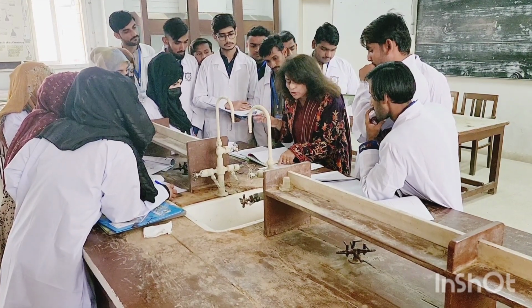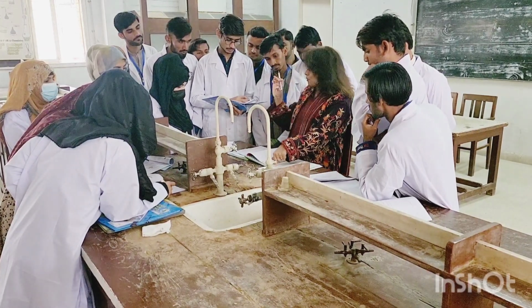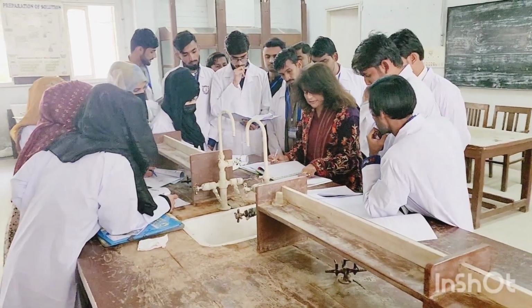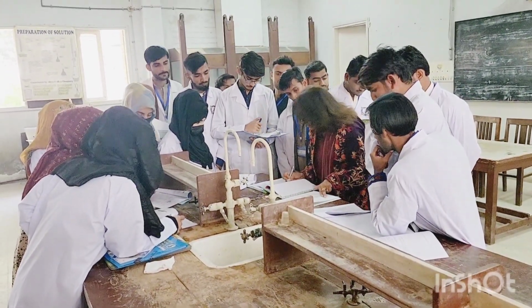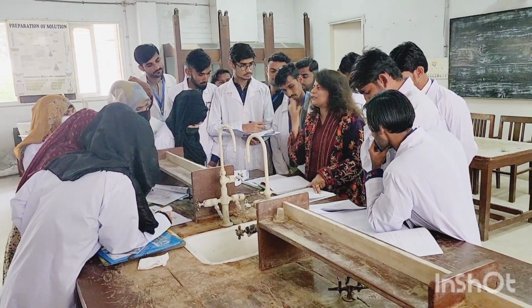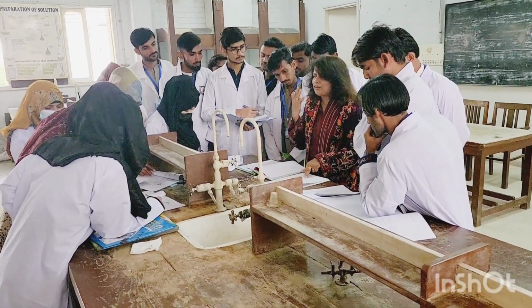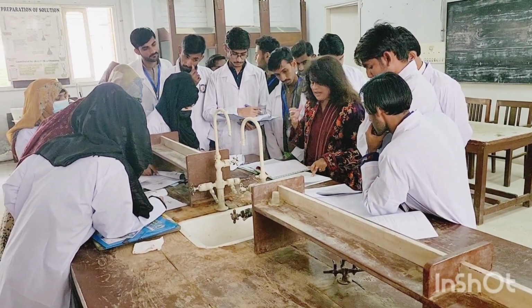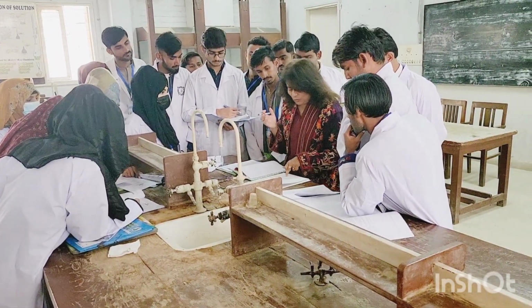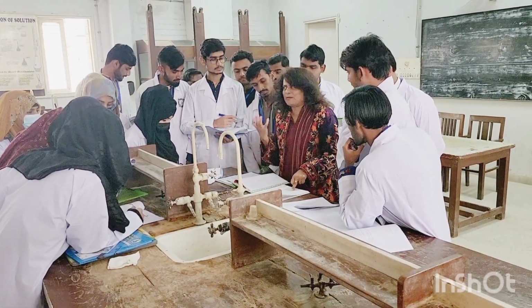So you will write down all these options that are given: carbohydrates, phenols, aromatic acids, X, Y, Z, and then you are going to write down "may be present." Right? So this is the color, okay, and then third is your odor. Odor means the smell it has. Now they have given us the options. Pleasant smell. If it has got a fishy smell, fishy means that is not that good, right? So amines could be there. If it has got bitter almonds, meaning kadve badam, bitter almonds.